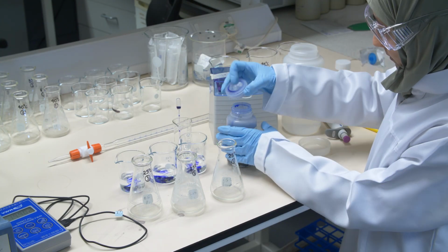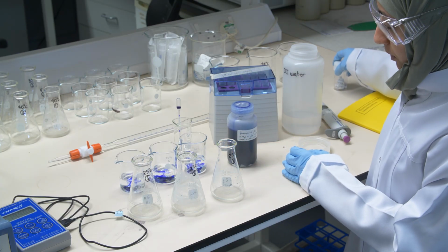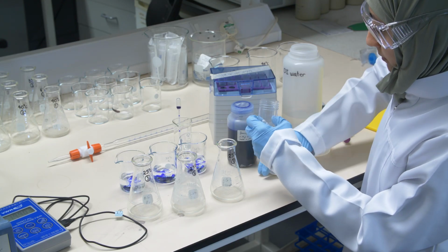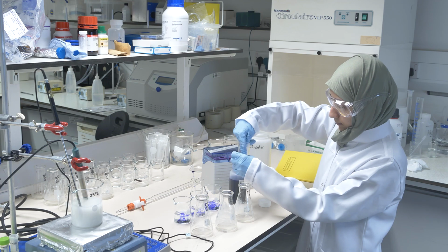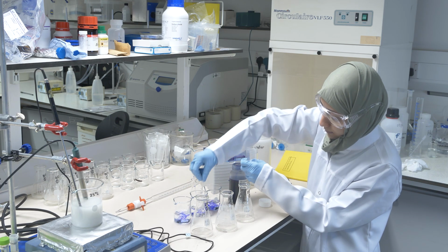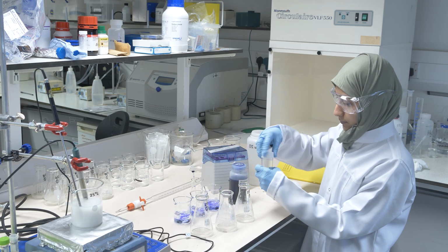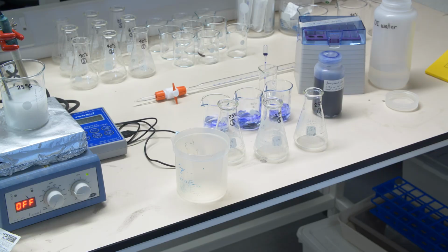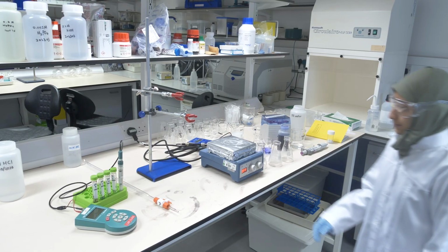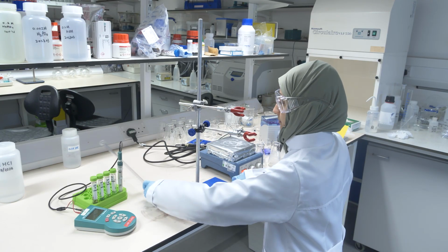And in the next step, we take a magnet and add it to the beaker, so that we are able to stir it, through different magnets, one after the other. And once that's done, then we discard the pipette in the waste, and then we set up our new titration setup. We assemble it.